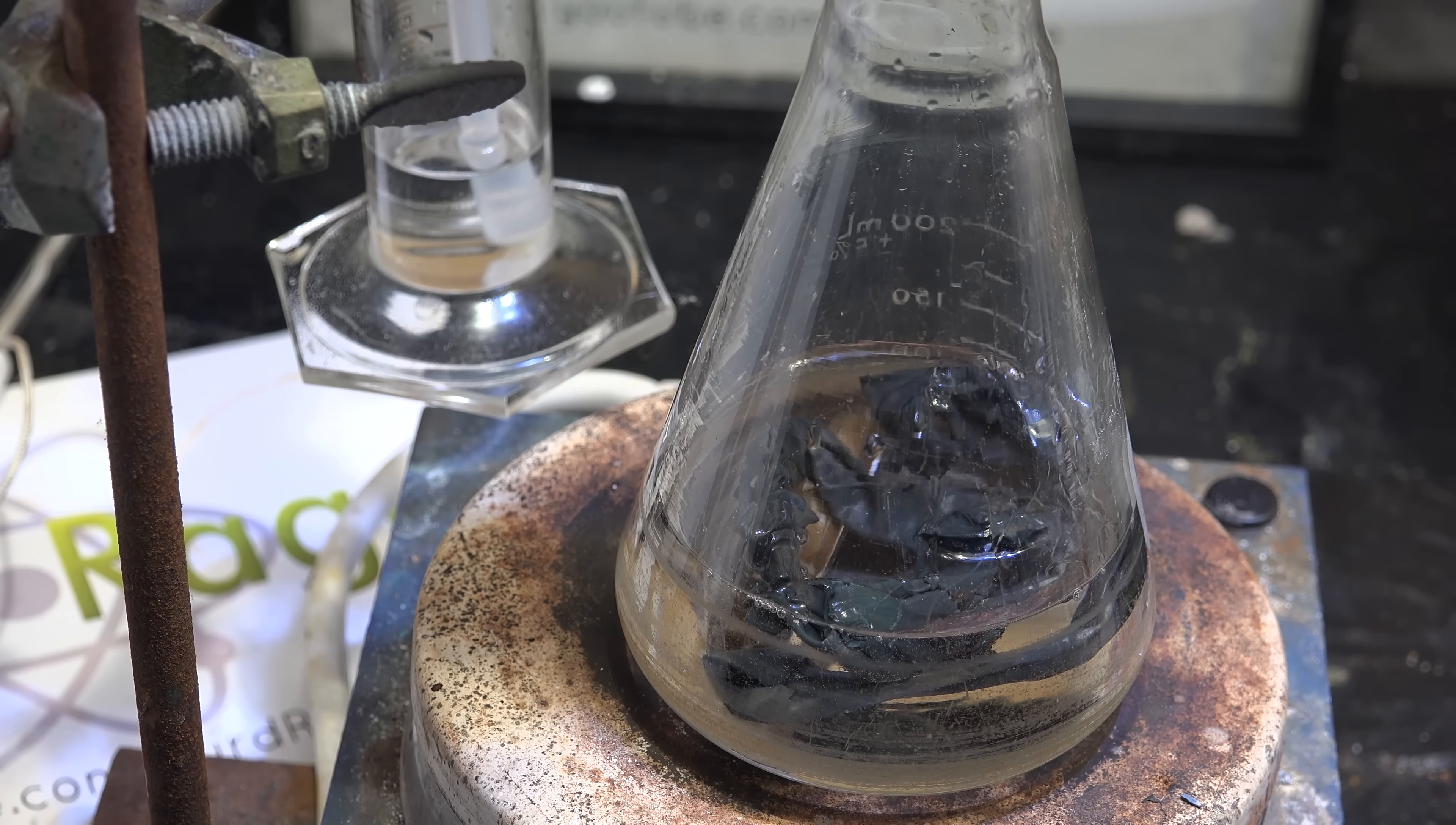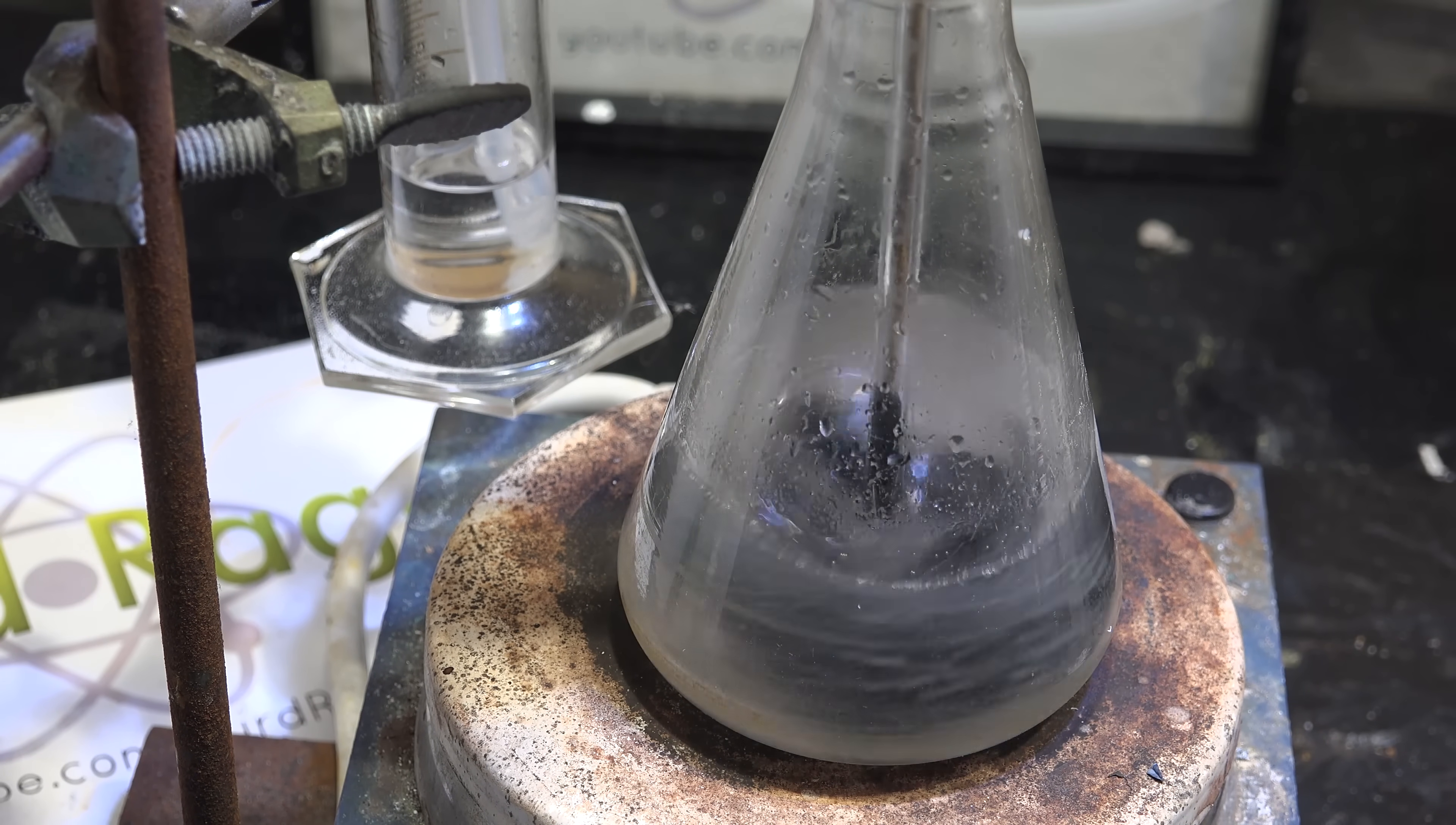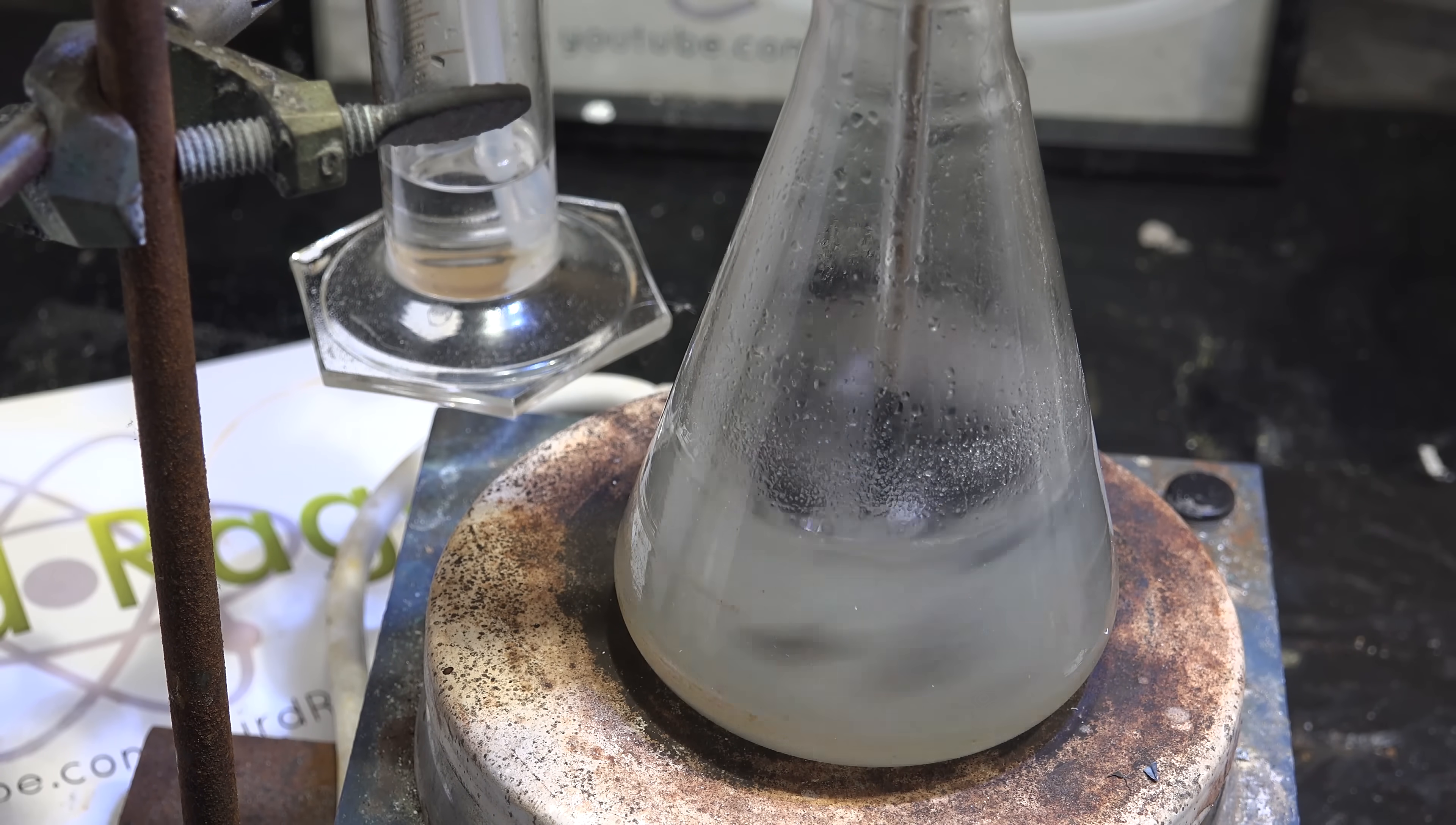This time with lithium as reductant along with sodium hydroxide and mineral oil. I heat it up to 125 Celsius and just let it stir for 8 hours. I and many other amateurs have already tried running it with magnesium and that didn't work, but there's always the lingering question if it was just something about the magnesium. Maybe the alcohol actually destabilizes the magnesium oxide coating allowing the actual metal to react. I don't know, but lithium should be an even easier metal as it's very soft and any coatings are easily ground off as the mixture is stirred. If any metal would work without a catalyst, it would be lithium.